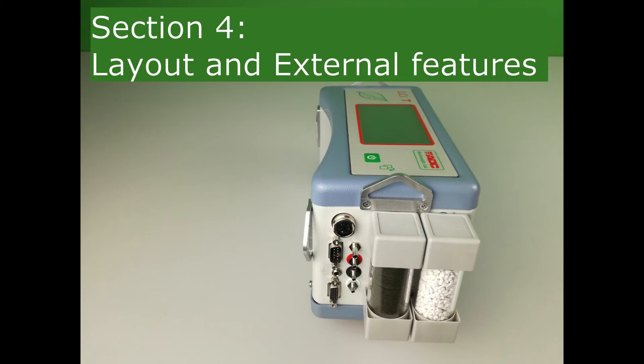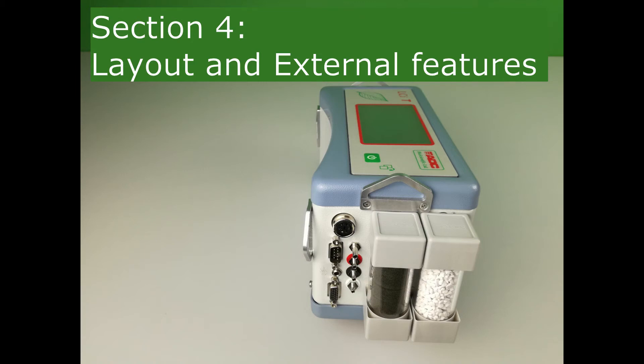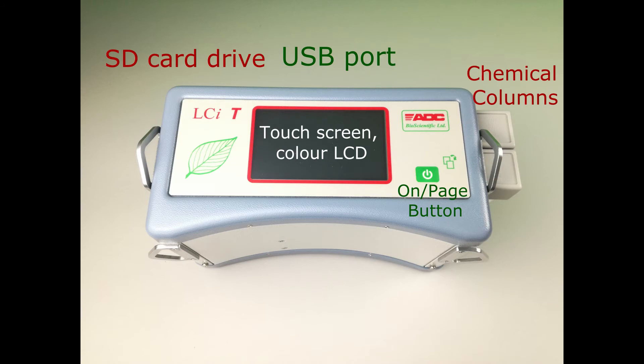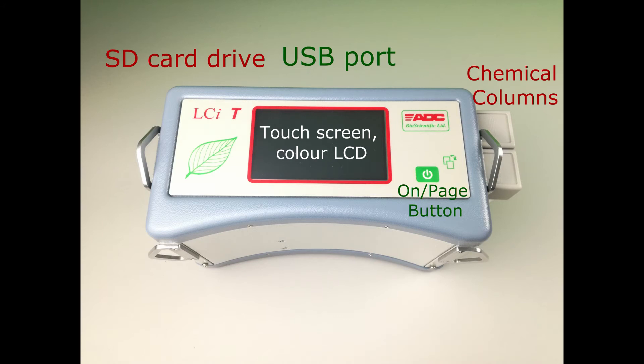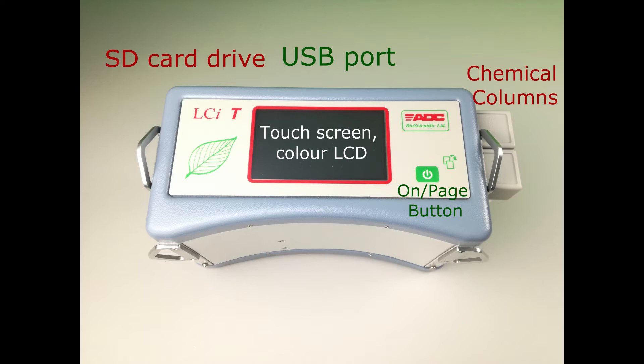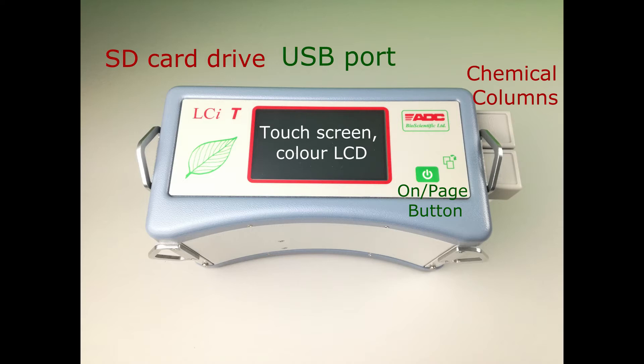The On Page button turns LCIT on and off and scrolls through the three main menus. This also functions as a confirm and returns you to the previous page when viewing submenus.